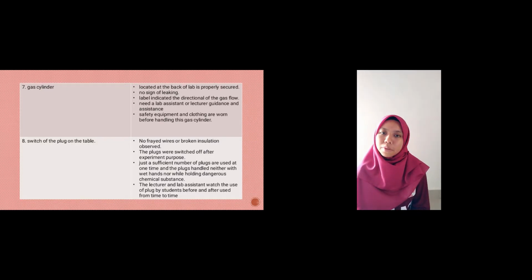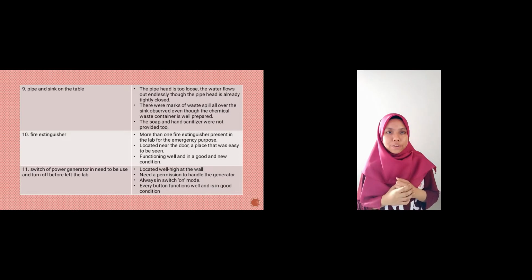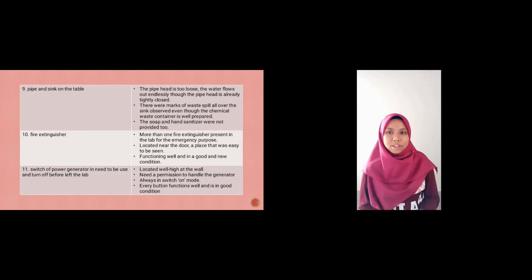The lecturer and lab assistant watch the use of the plug by the students before and after use from time to time. The ninth inspection is about the pipe and sink on the table. The pipe head is too loose and the water flows out endlessly, though the pipe head is already tightly closed. There were marks of waste spills all over the sink observed, even though the chemical waste container is well prepared. The soap and the hand sanitizer were not provided too.